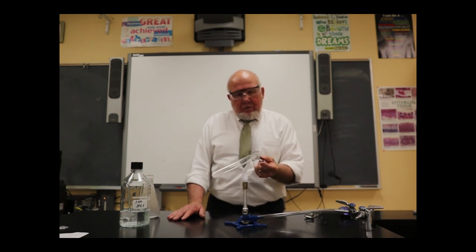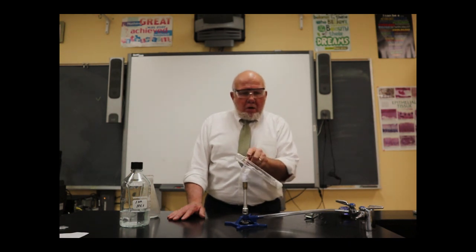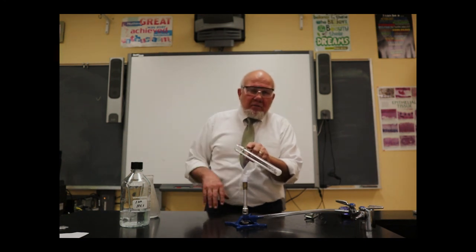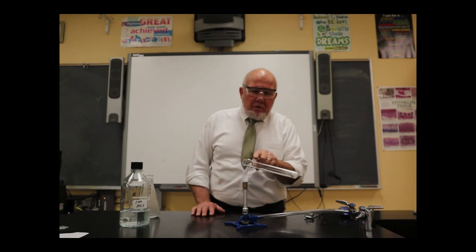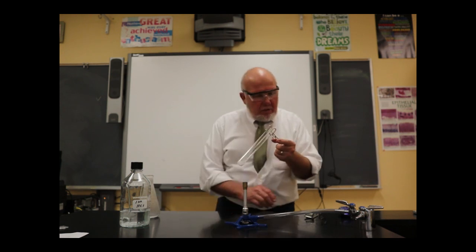See if we can get up here and heat up the test tube. Get rid of that water that's up there. Moisture, condensation. The hot steam rises to the top of the test tube. The top of the test tube is a little cooler, so the hot steam condenses. And get that condensation there. Oh, that's looking good. Now I want to make sure it's good and hot, evaporating. And I'm going to come show you what it looks like.